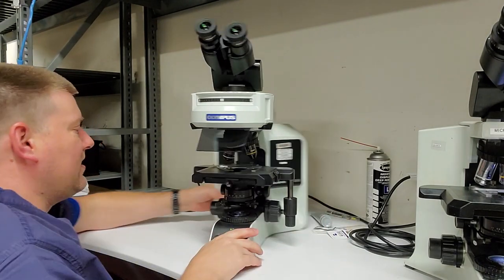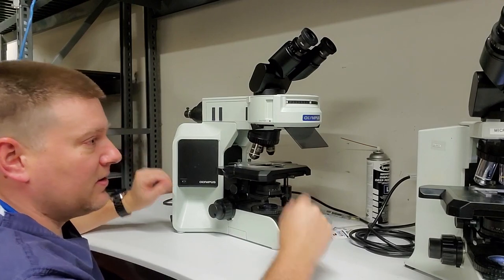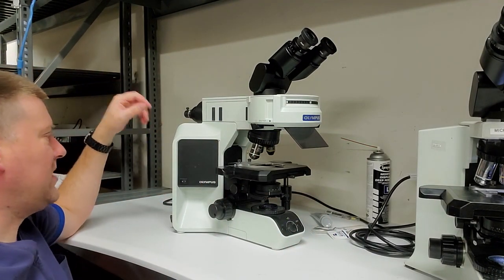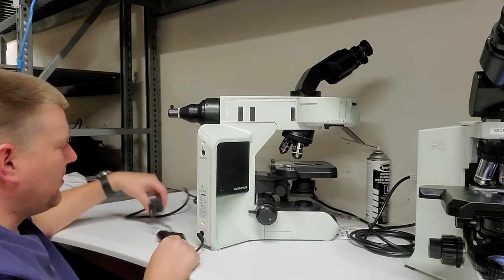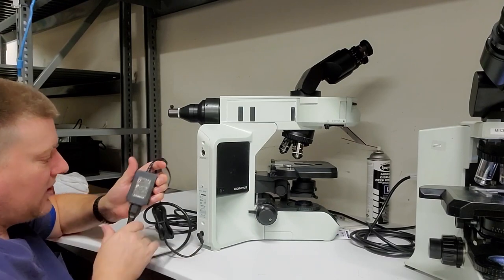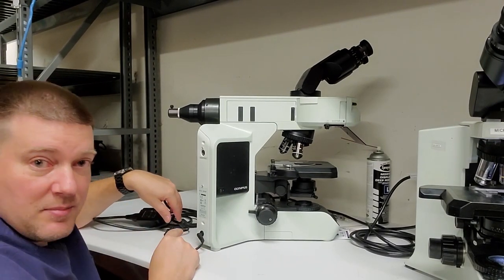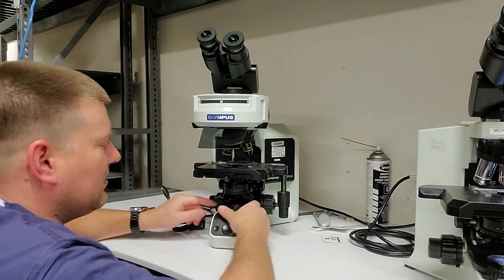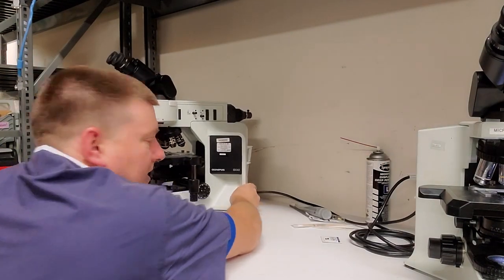But this one here is exactly like that one over there, except for the headstock being different, and I can swap the headstock around. That's one of the cool things about Olympus and some of these major manufacturers. There are some other options, but the biggest difference right here is this guy. It has an external power supply, which powers the LED bulb, which is a very cool feature. It makes that light nice and cool. But I'm not going to open that guy up.